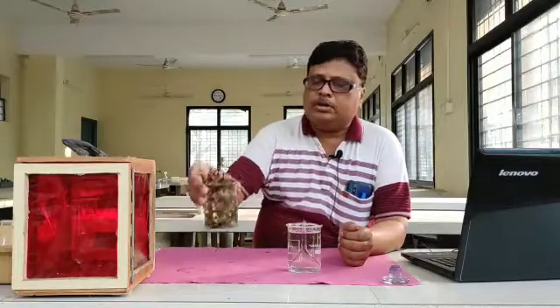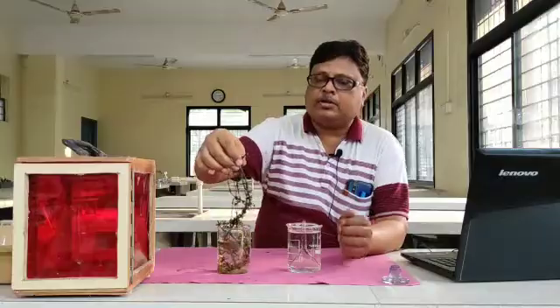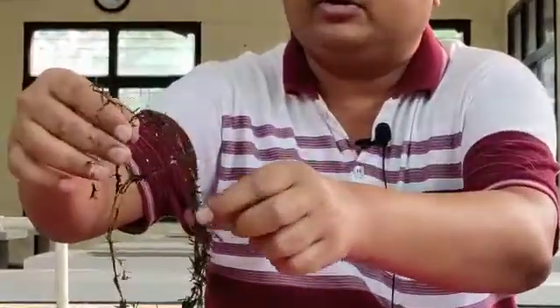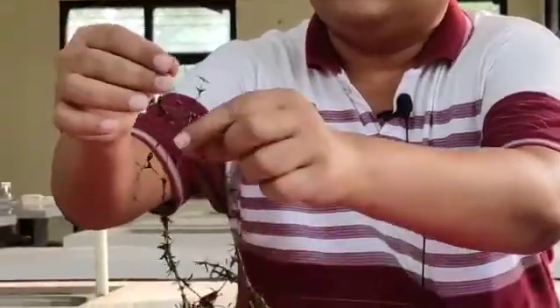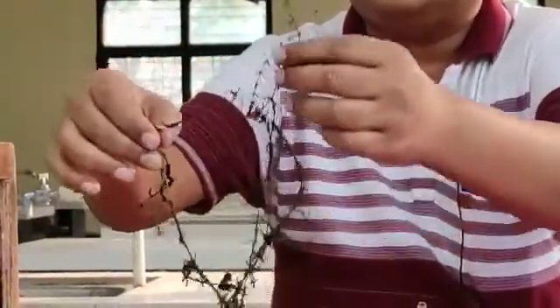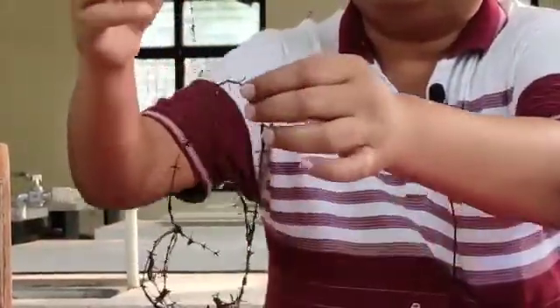We have chosen this hydrilla. This hydrilla is a submerged, rooted plant — it is called a hydrophyte. In your hydrophyte studies, we have already studied this particular hydrilla plant. These are the ramifying branches of the hydrilla plant.